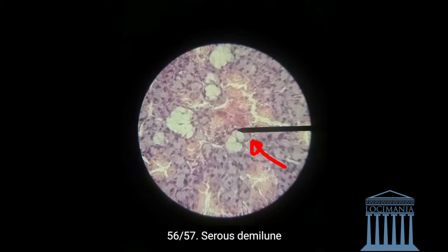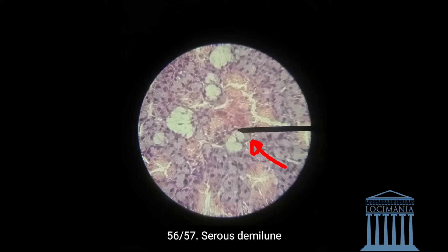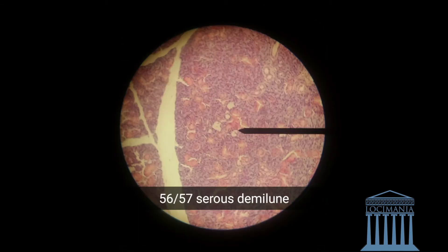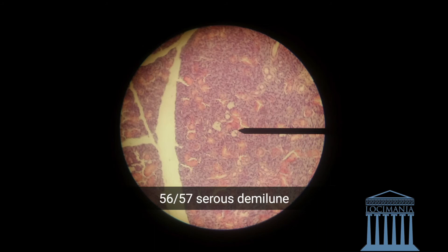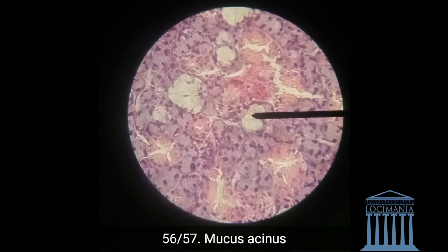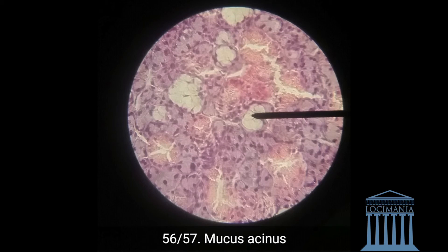And lastly we have the serous demilune, which lines the mucus acinus — it doesn't exactly cover it, it kind of lines it. Here we have the serous demilune, and the white hollow thing there is the mucus acinus. Here is a better picture — the mucus acinus is the mucous part, and on top of it we have the serous demilune.